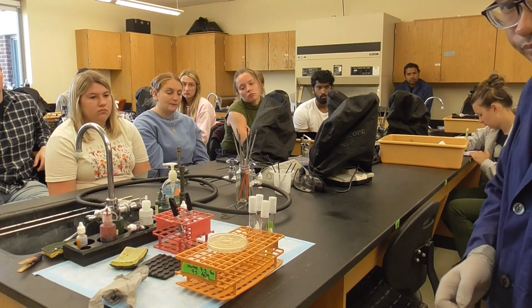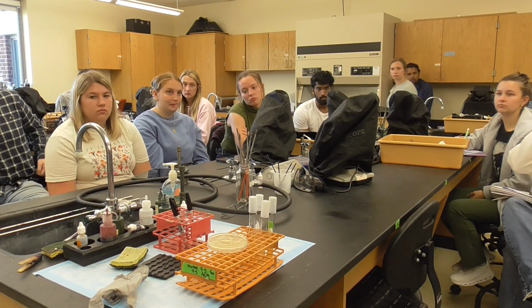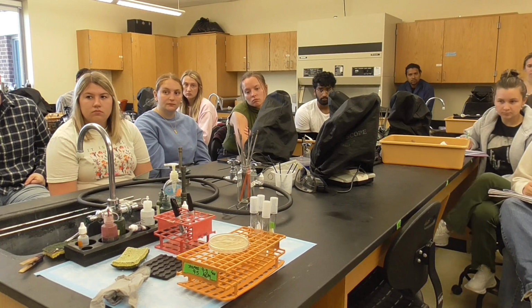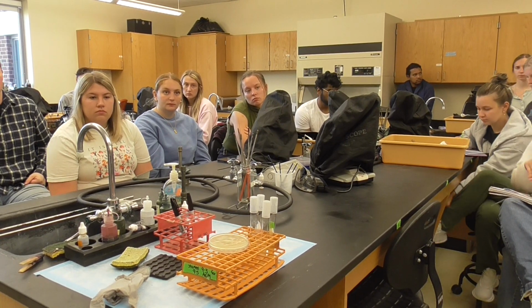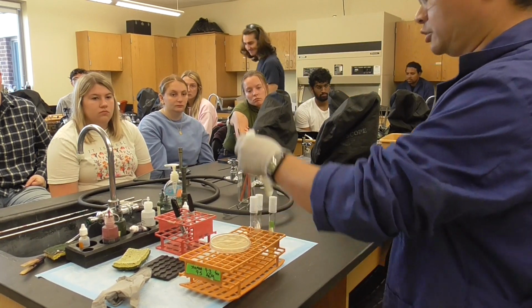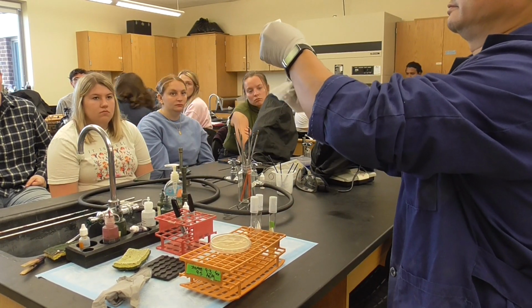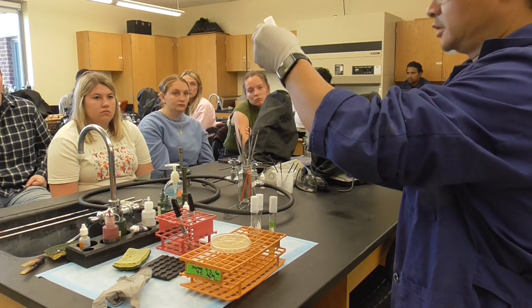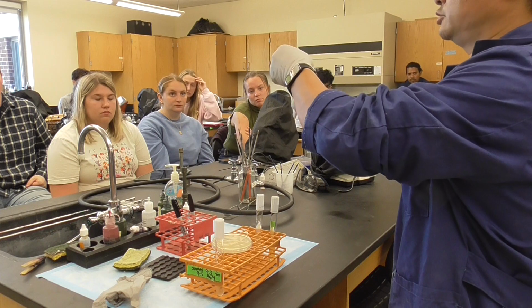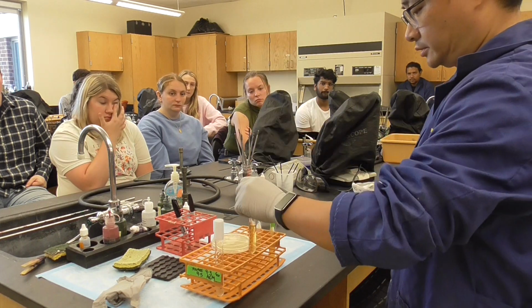First thing first, these agar plates and the broth are just coming out from the refrigerator. What does this mean? Humidity could be present. So what do you do? Dry it. Otherwise, your marker cannot write on it. Okay, all of these should be dried.